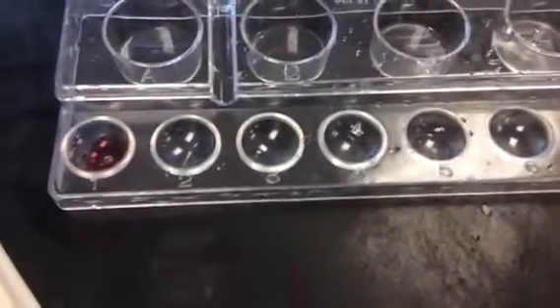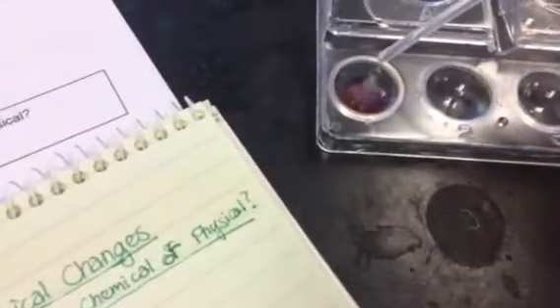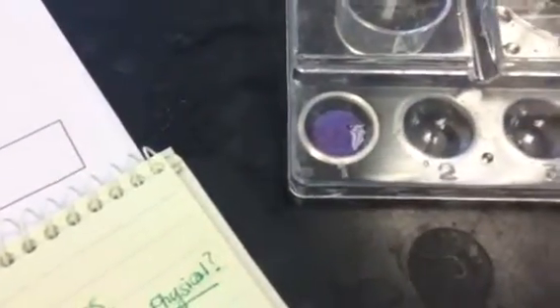And sodium phosphate. 1, 2, 3, 4, 5. So go ahead and write down observations and then decide whether that is a chemical or a physical change.